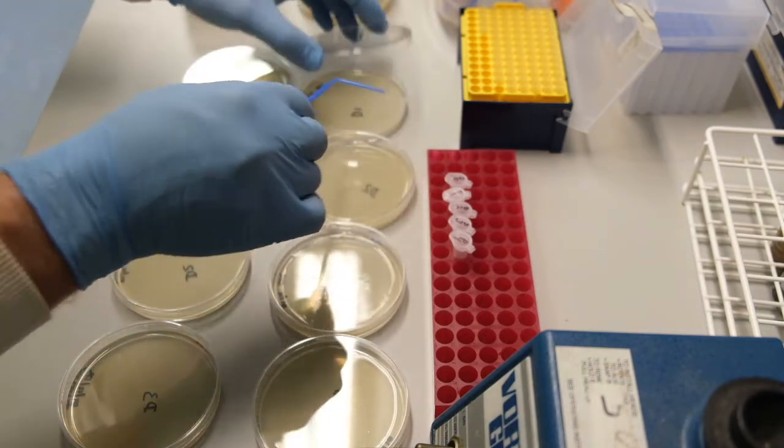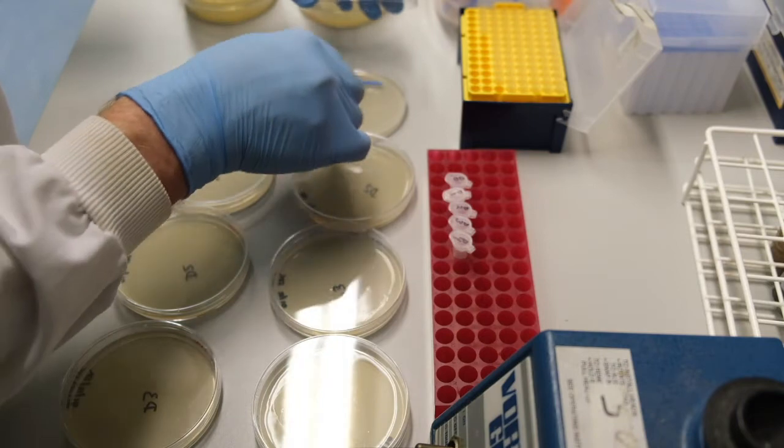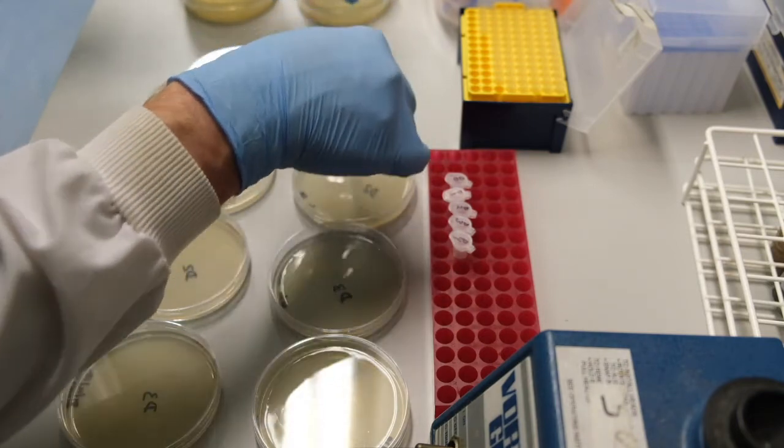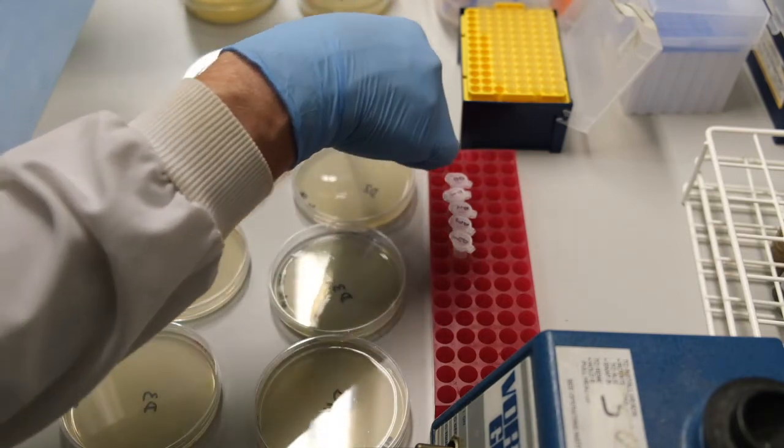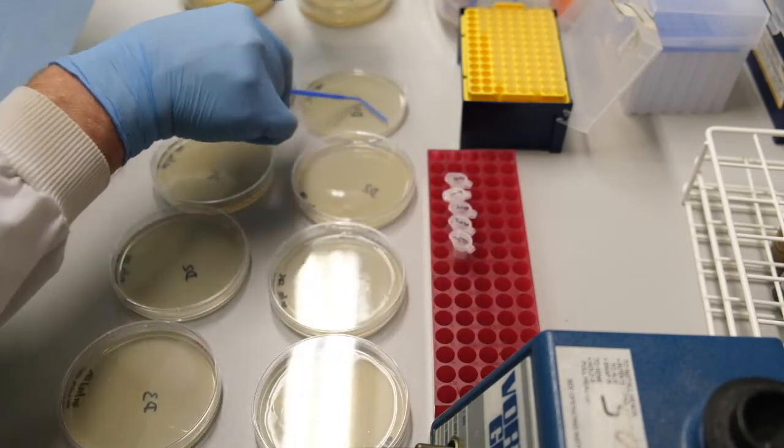It is a good idea to keep the lid of the plate over the area where you are spreading to prevent contamination from falling onto your plate as you spread.